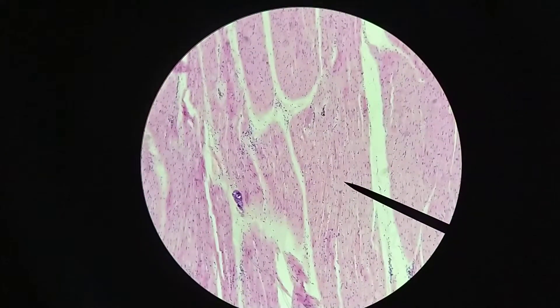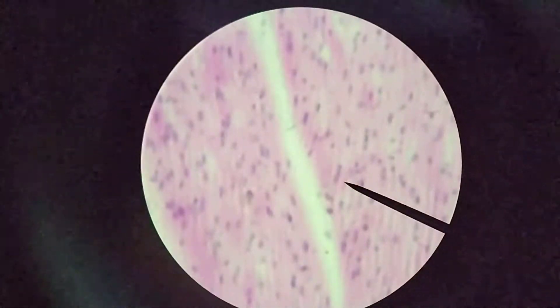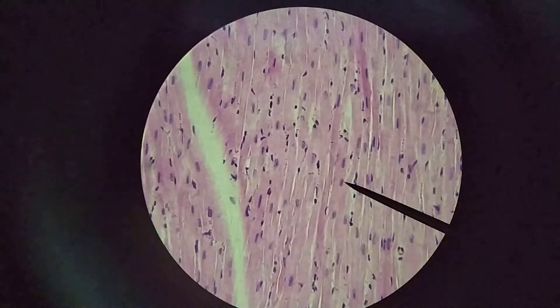Let's take a look at some longitudinal sections through cardiac muscle, just to get an idea of what that looks like under the microscope. So here we are at 400x, looking at longitudinal sections through cardiac muscle. Some things to notice here — if you look carefully, you might notice that there's some branching going on. For example, just above the pointer, there's a very obvious spot just above the nucleus where the cell seems to split off into two directions.